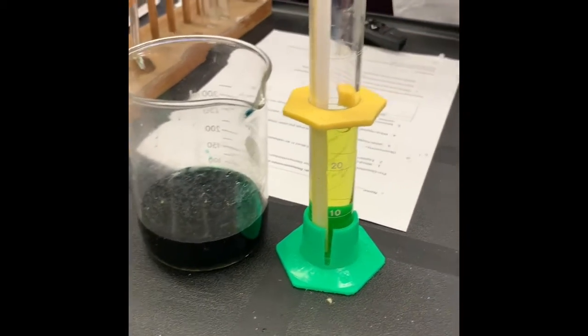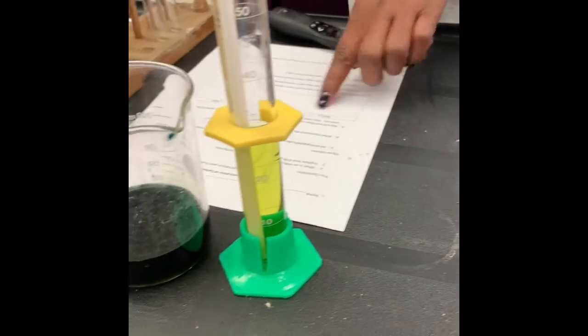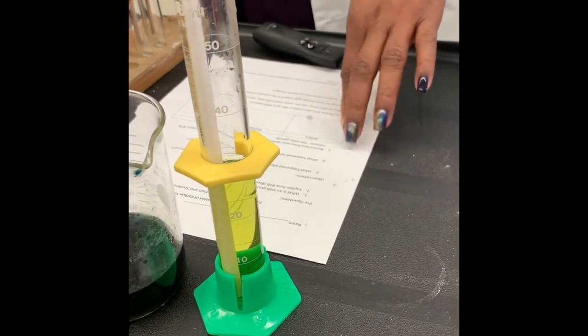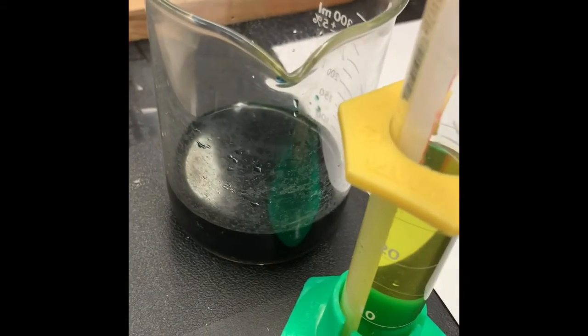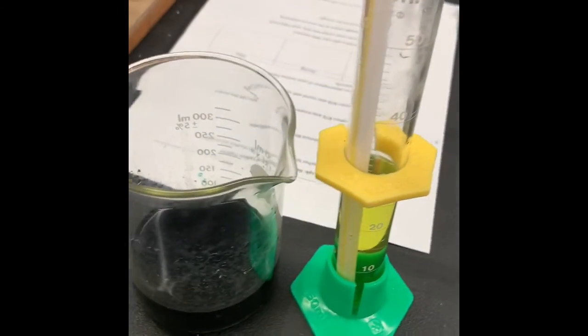On your lab sheet, you drew with your color pencils the before, what happened before, the dark color, then during while I was blowing, and then of course what occurred. We have a yellow color now. So in your groups, have a discussion, and let's discuss the 3 questions on your sheets.